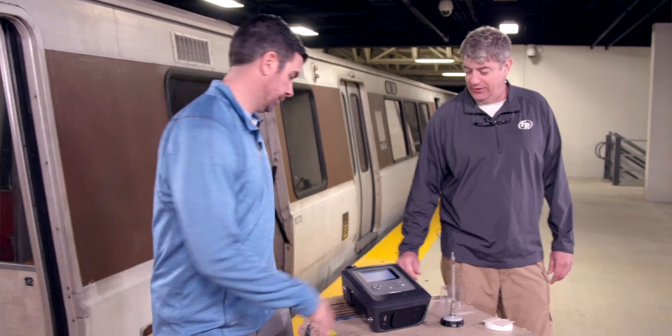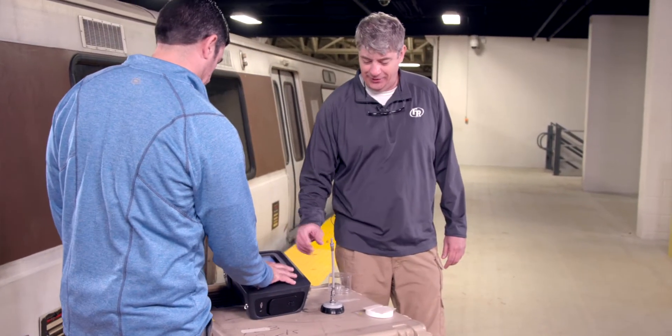Welcome back. We've already run a vapor mode scan using the MX908. Now we're going to show you how to do a trace sample run with the MX908 mass spectrometer.